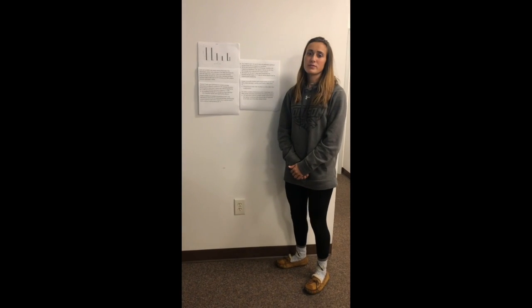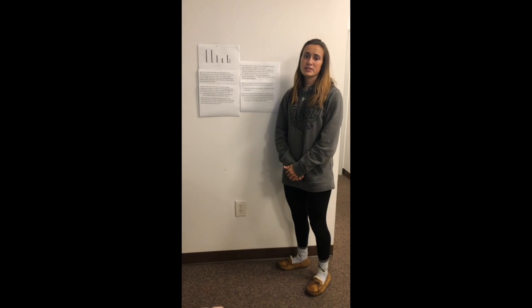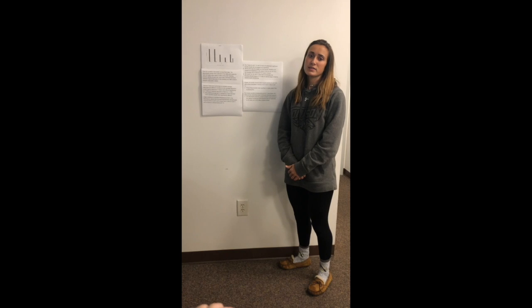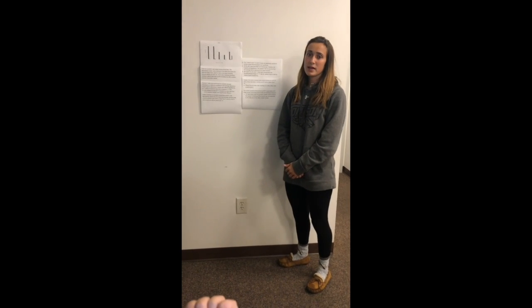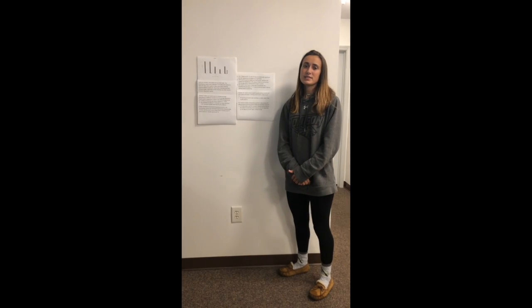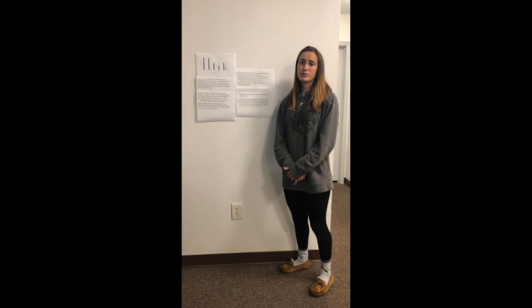In this bar graph, we have displayed our averages, standard deviations, t-tests, and the x-axis displays pH. The y-axis is described as absorbance. As you can see, there is a valley at pH 9 and 10, though we hypothesized that there would be a peak. A t-test is used to show the significant difference between 2 groups.